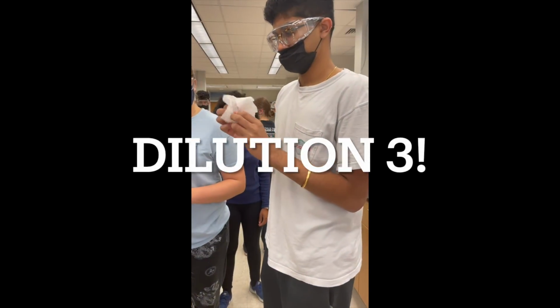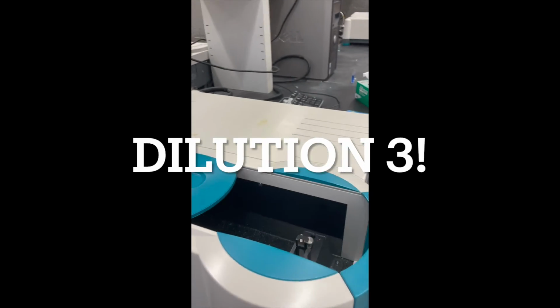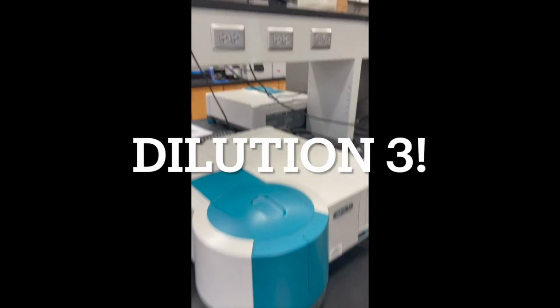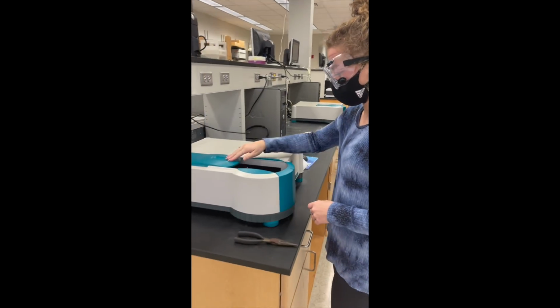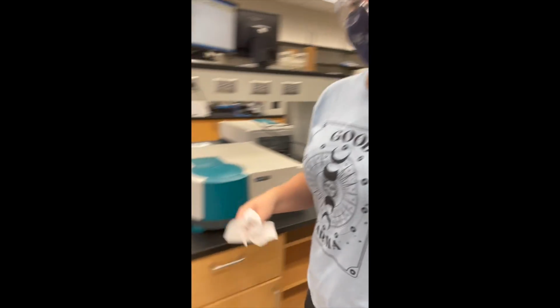We clean both sides of the cuvette so that the spectrophotometer can read the absorbance of the solution. Place the cuvette in the machine with clean sides towards the beam. Close the door before scanning. Scan the absorbance and record the value in your notebook. Make sure to carefully remove the sample and shut the door when you're done. Make sure to clean up your station.